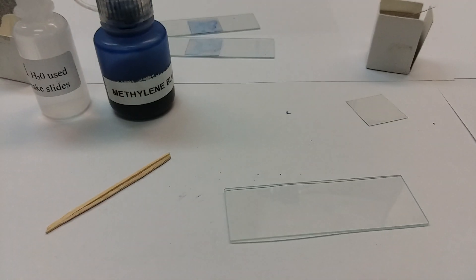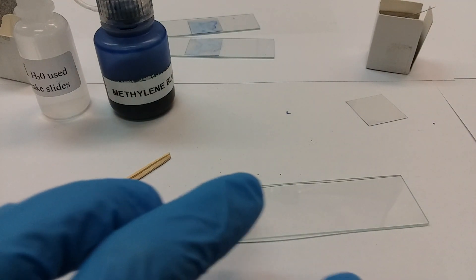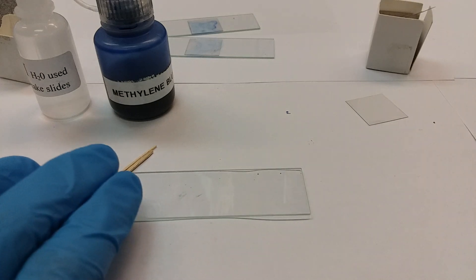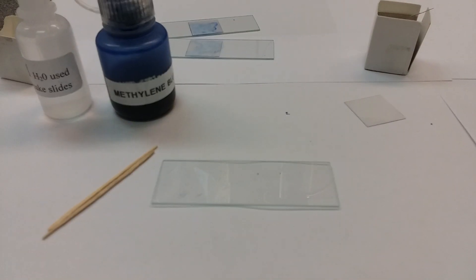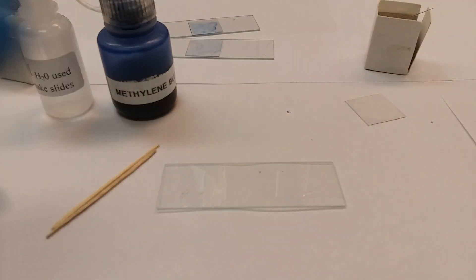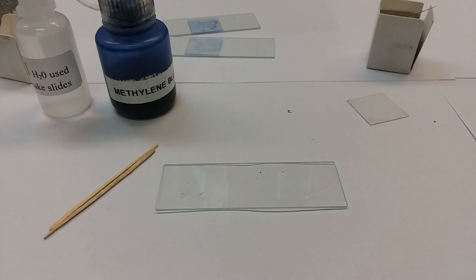Now we have a nice clean fresh slide. You may open up the slide box and note that there are papers covering the slides - that's to keep them from scratching against each other and getting any kind of damage. So I have a nice clean slide here.